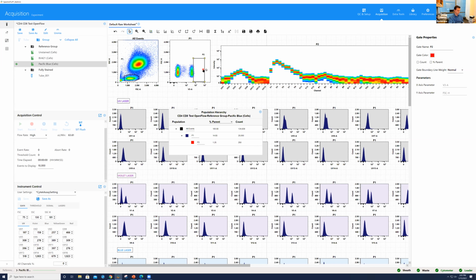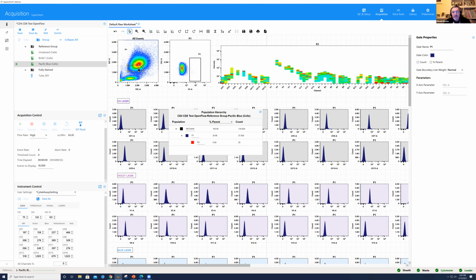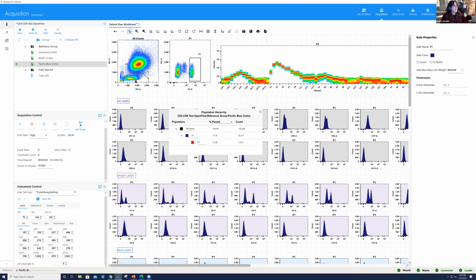Yeah. But the pattern there is going to be similar if you were looking at another population, right? Because it's the fluorochrome that you're looking at there rather than the actual background cell. Right. So if your BV421 was on a neutrophil marker, for example, the pattern would be the same. Yeah. So you can see if I come up here and go down there, the signature still remains the same. It's just the different carrier particle. So we're looking specifically at the fluorochrome itself.